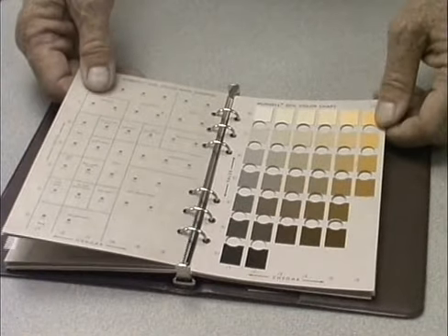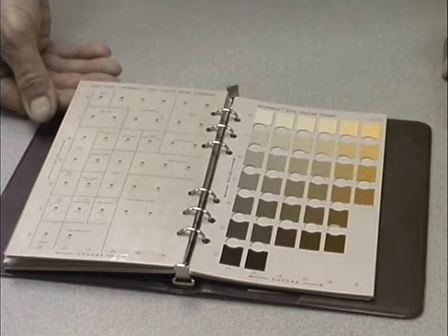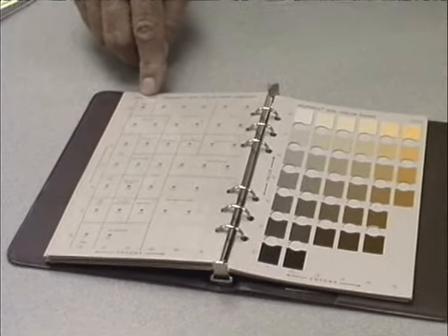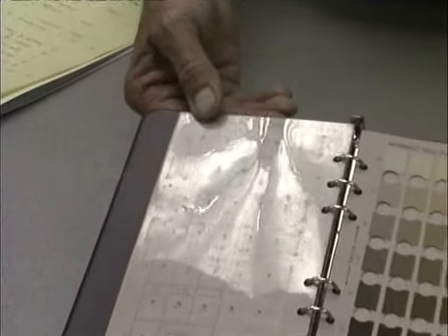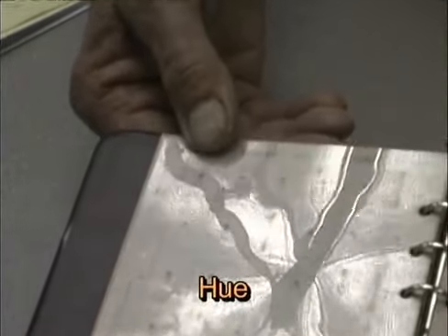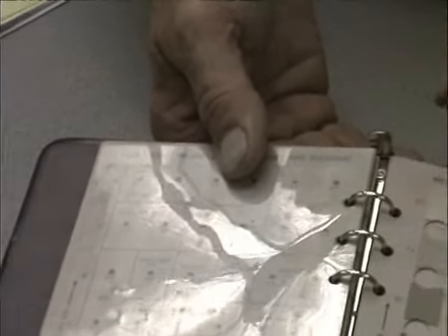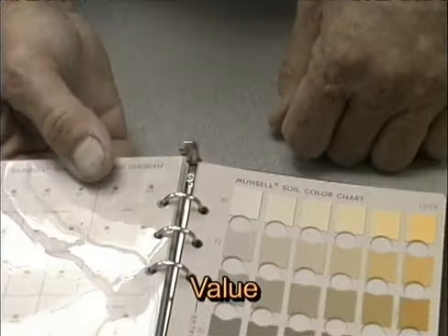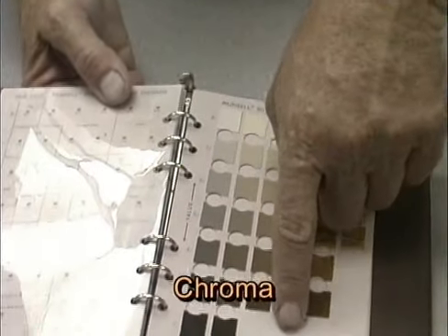Okay, in this particular soil exercise, color of the soil based on the Munsell system is based upon three values. The one printed at the top of the chart, in this case, the 10YR, is called the hue. The numbers or horizontal rows running across are called value, and as we go across with the vertical columns, these are called chroma.